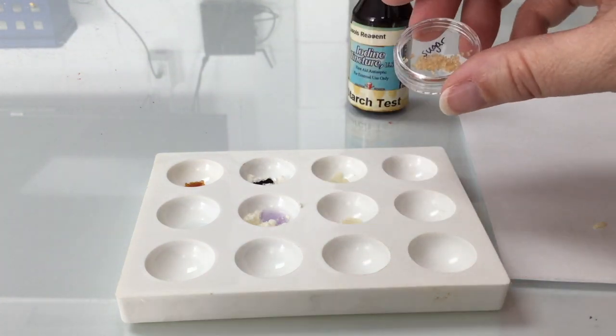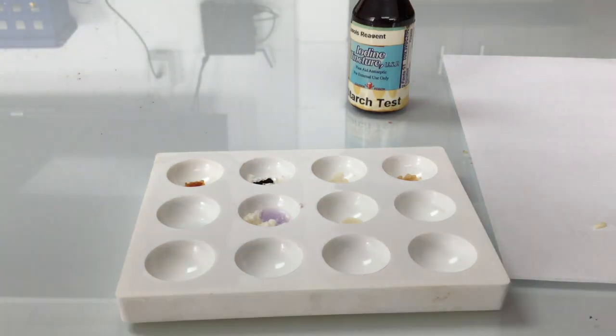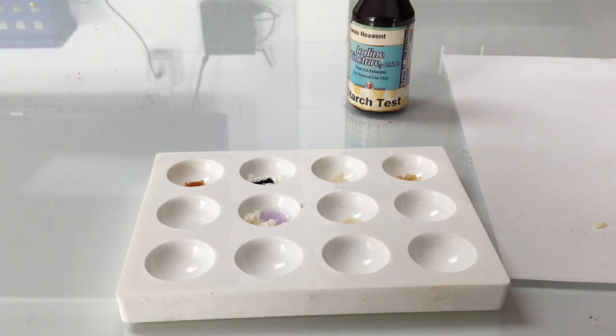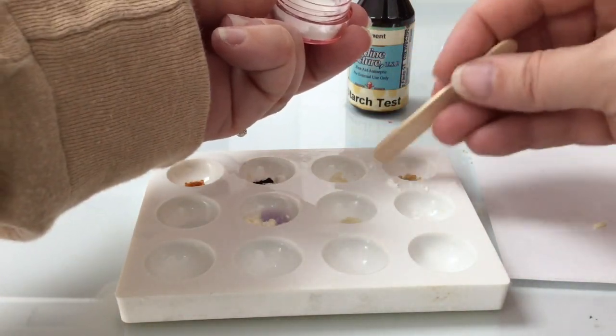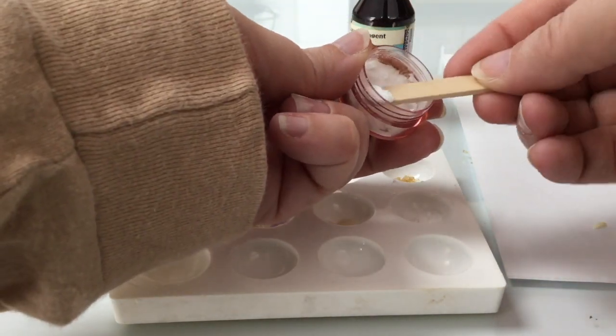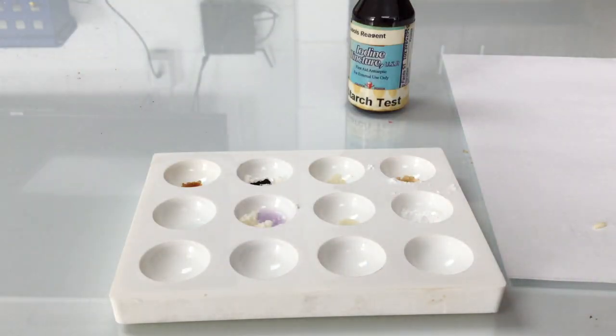Now we will test sugar. Sugar is purely a carbohydrate, so we're not going to test it for the protein, but we'll see if it is a starch. But we will compare sugar to powdered sugar, which is a mixture, and we will see if the powdered sugar has any of the starch in it, and if there are differences between that and the regular sugar. Since it is a mixture, we will also test the added ingredient for protein, which I'm putting in the bottom tray.